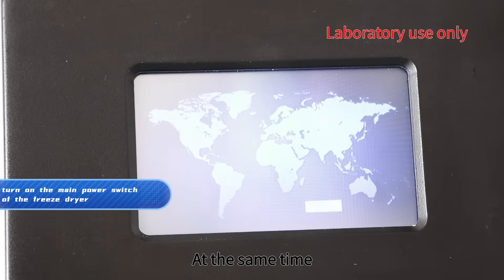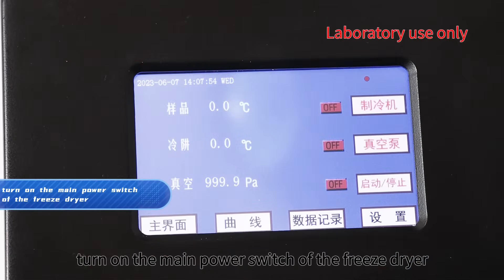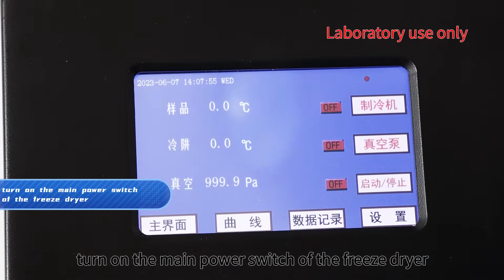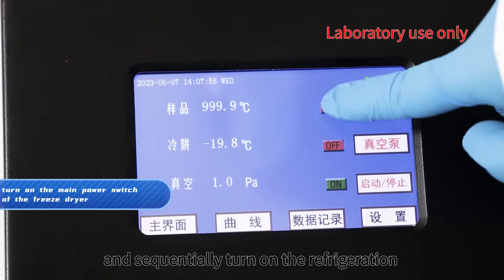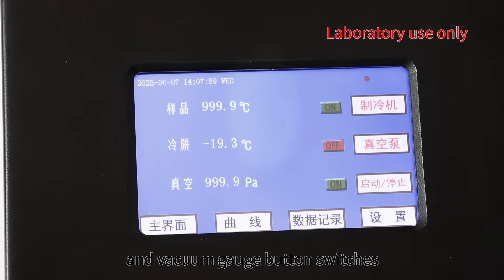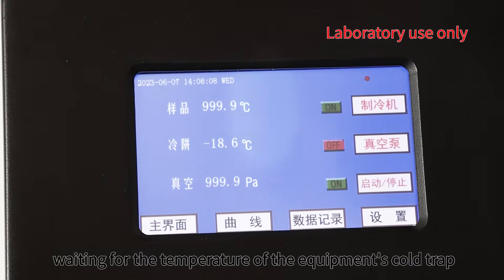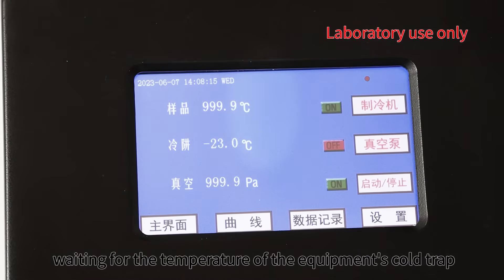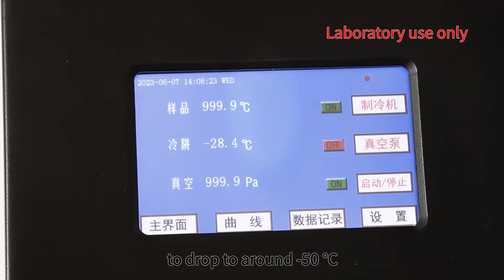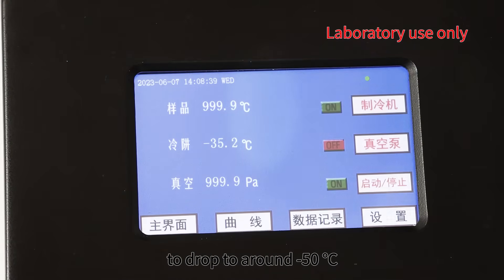At the same time, turn on the main power switch of the freeze-dryer, and sequentially turn on the refrigeration and vacuum gauge button switches, waiting for the temperature of the equipment's cold trap to drop to around minus 50 degrees centigrade.